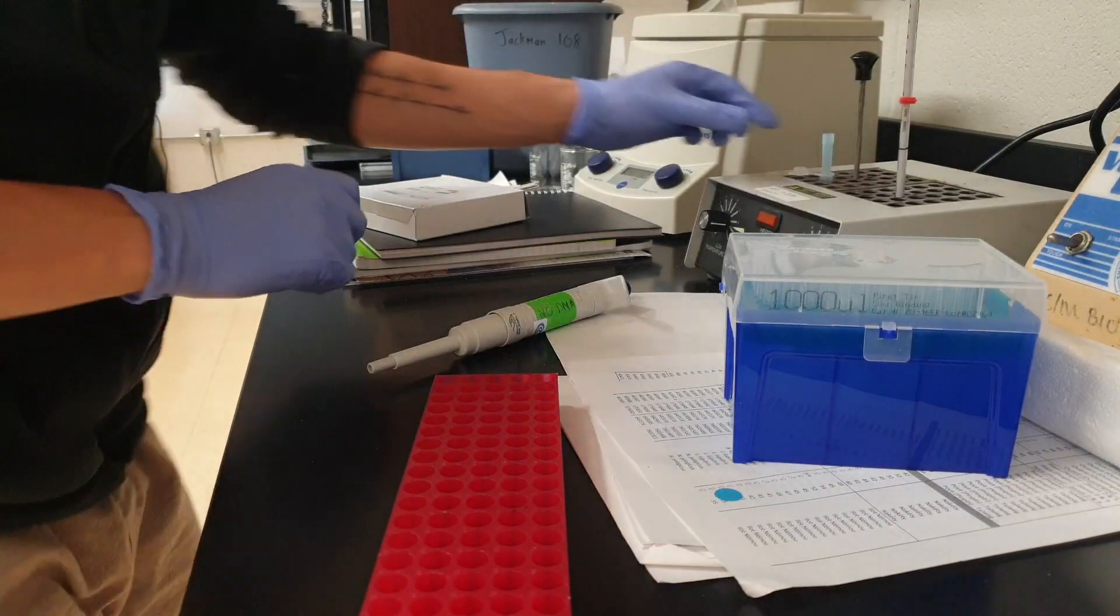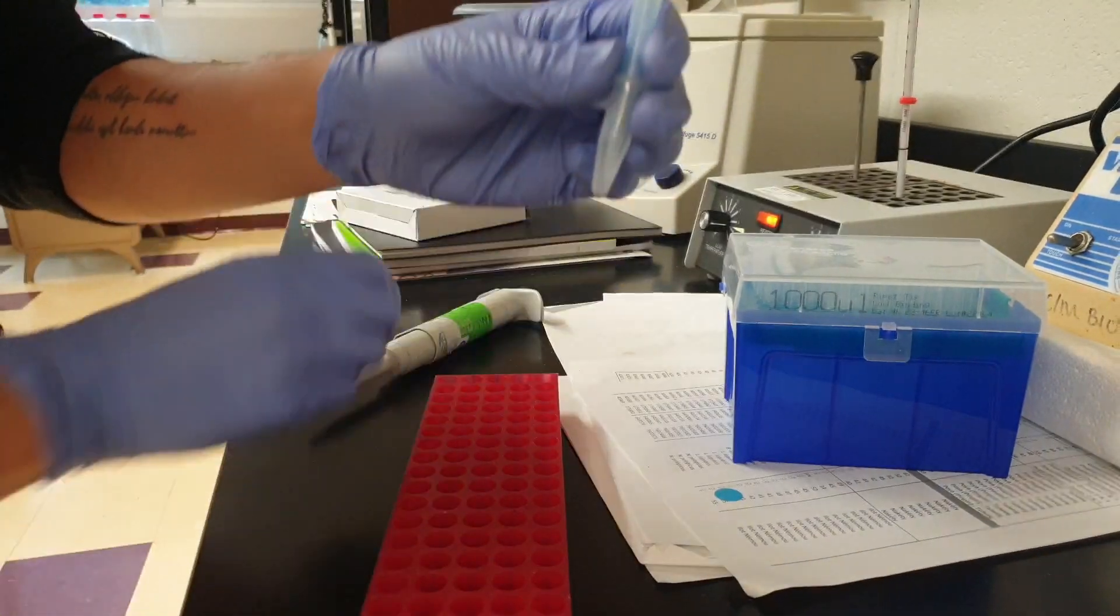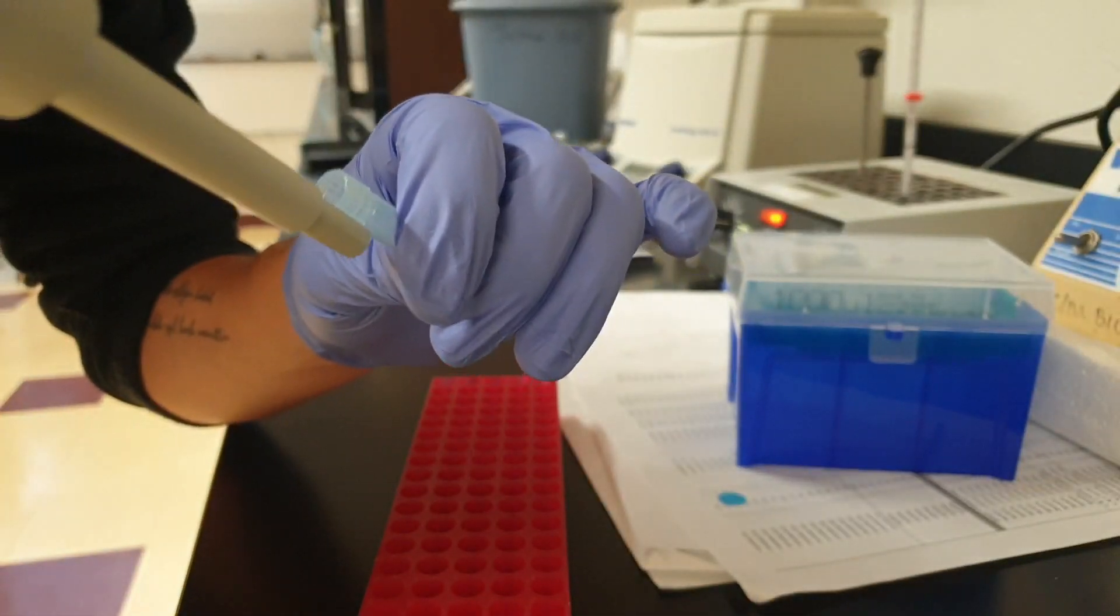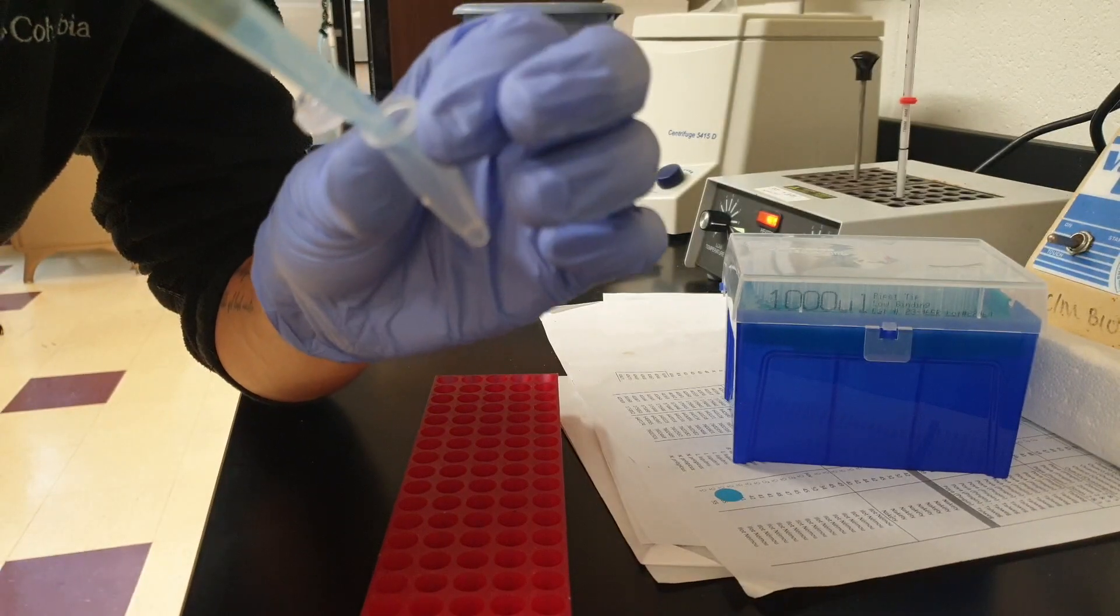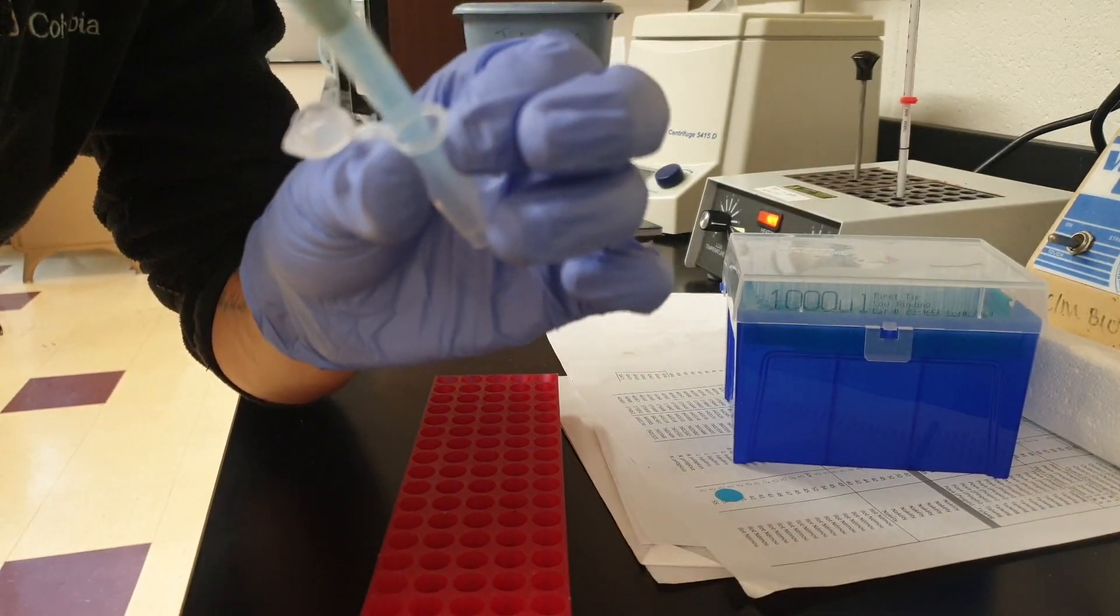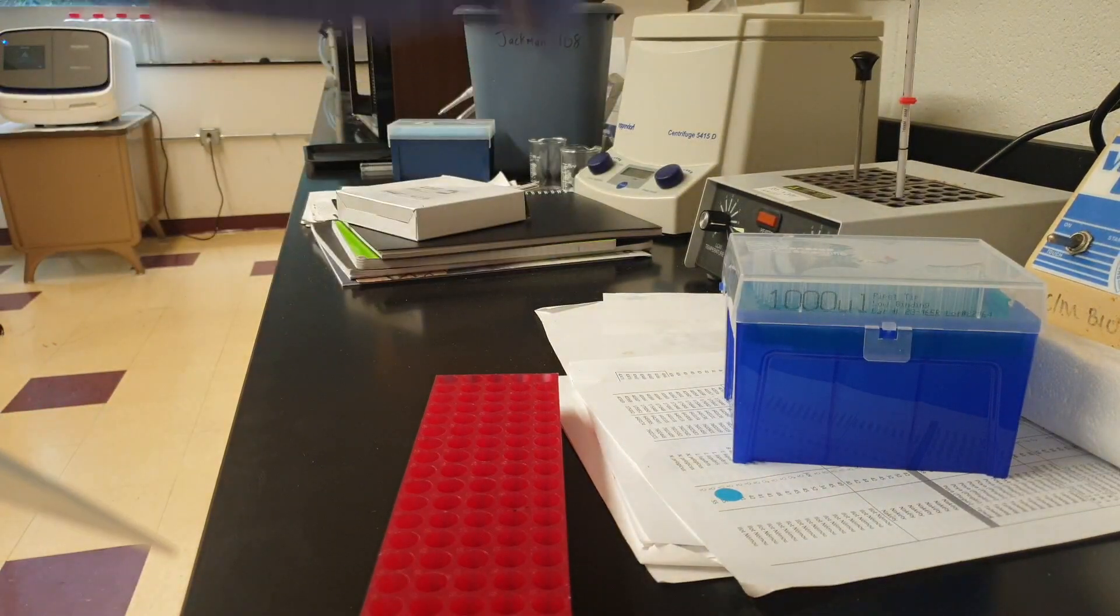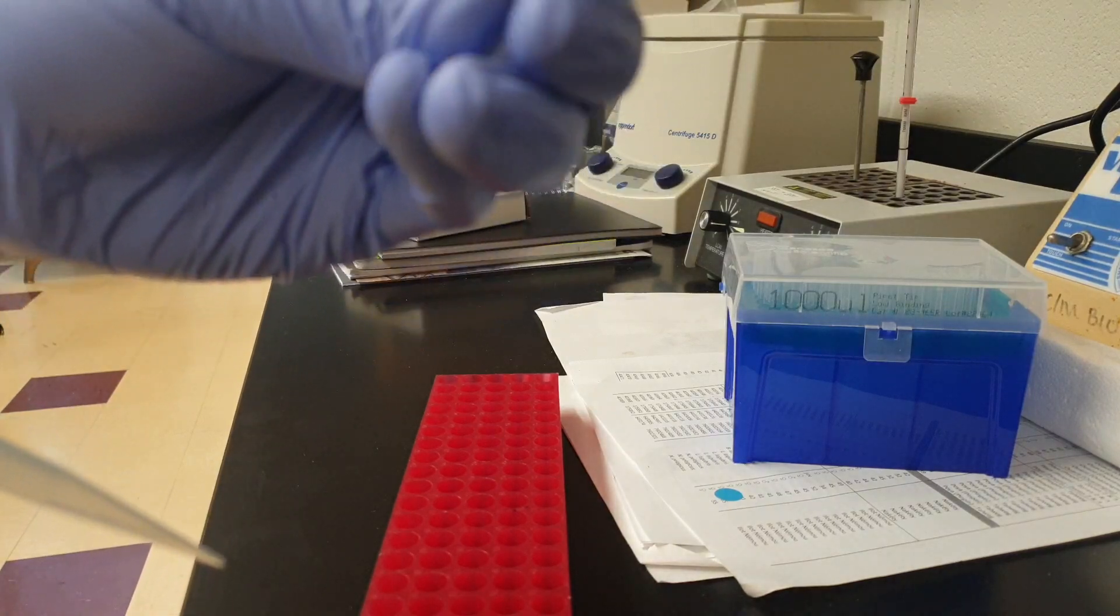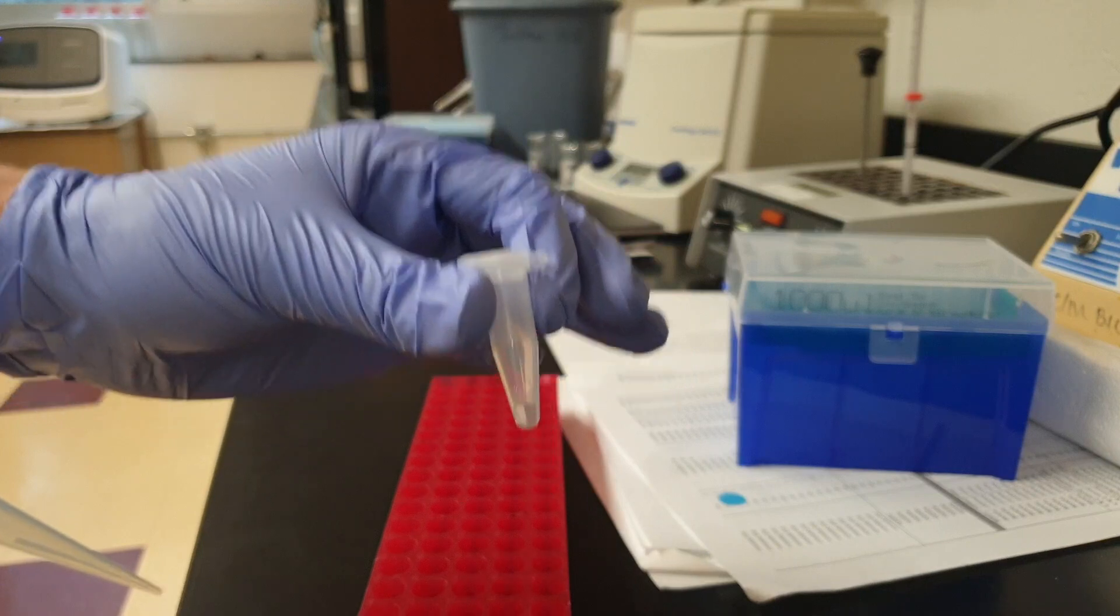Alright. We're back five minutes later. Let's take this out. Again, pipette tip goes in. And just squeeze it out. There's nothing here. So everything is inside that tube now. That's what we always wanted. Now it's time to label and do one more round of PCR.